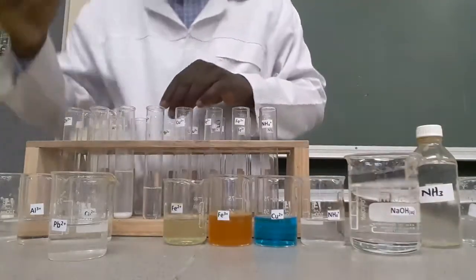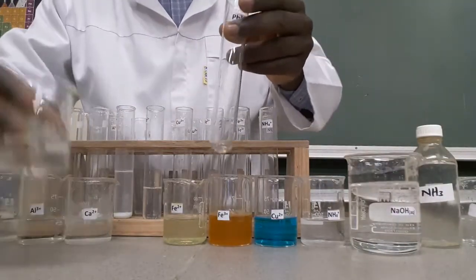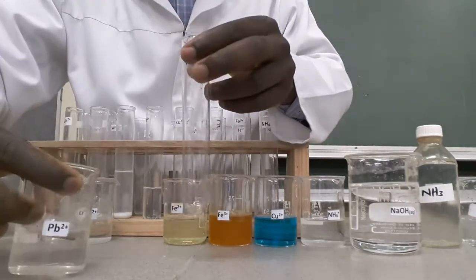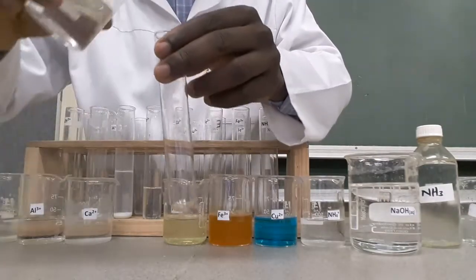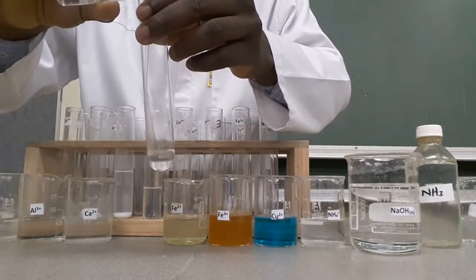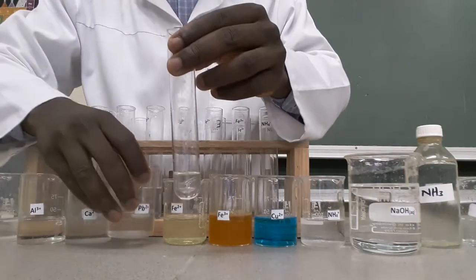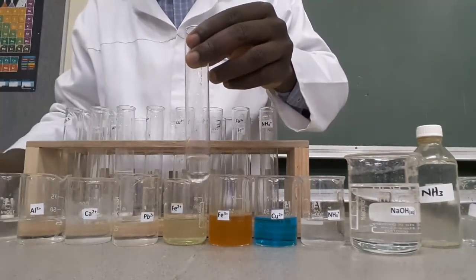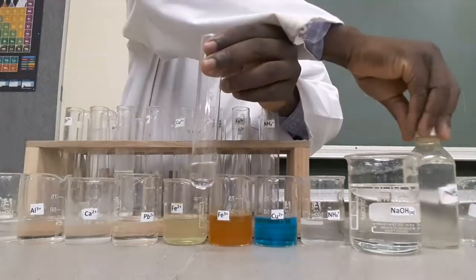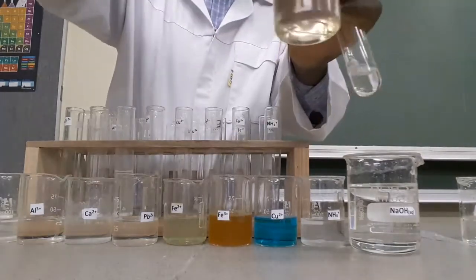Take a fresh sample of a solution containing lead ions. We want to use a different testing reagent — aqueous ammonia — to see the effect of aqueous ammonia on lead ions in solution. Add a few drops of aqueous ammonia.